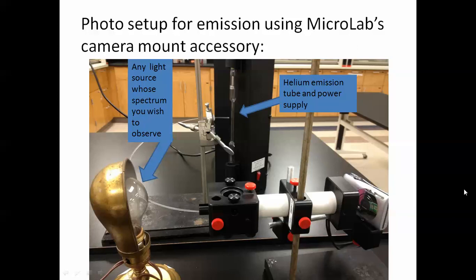In this case we have the helium emission tube and a power supply and a light source. Again, this light source could be another emission tube, such as hydrogen or mercury or carbon dioxide, water vapor, whatever. It could also be a fluorescent bulb, or it could be something like a candle or a chemical reaction that emits light. Lots of possibilities there.